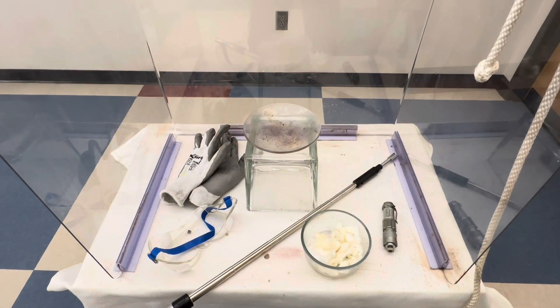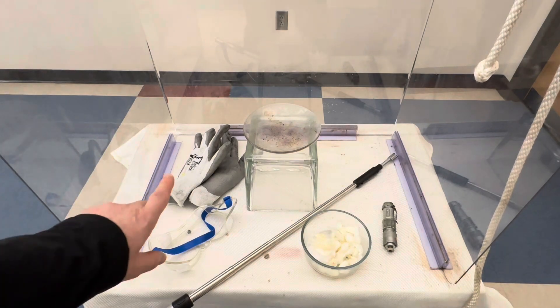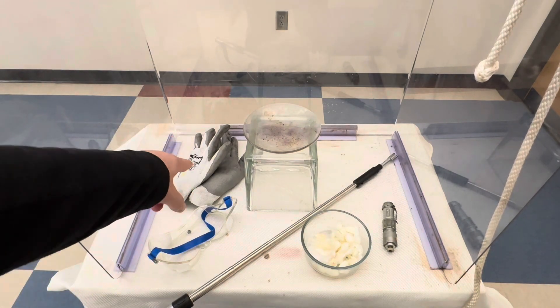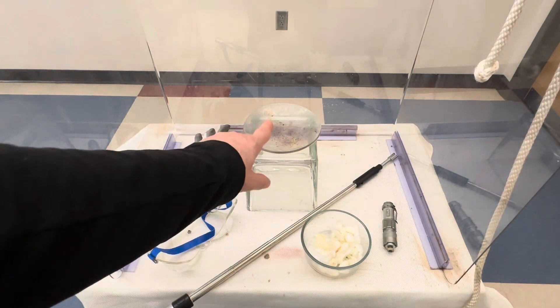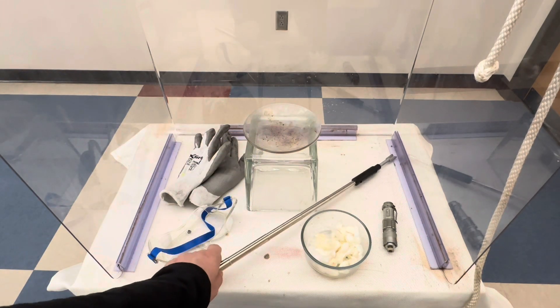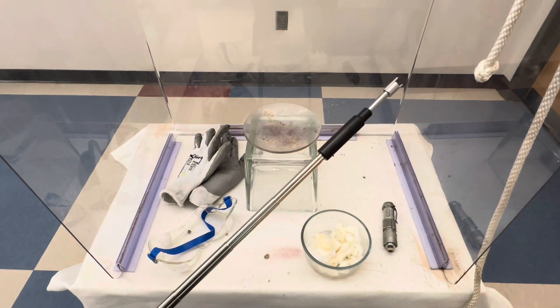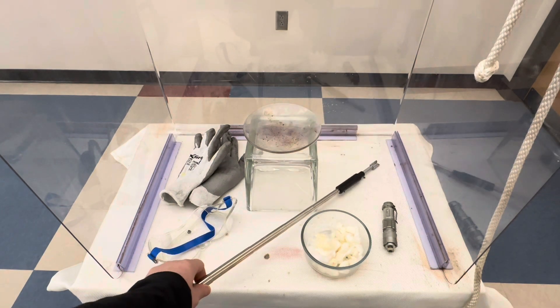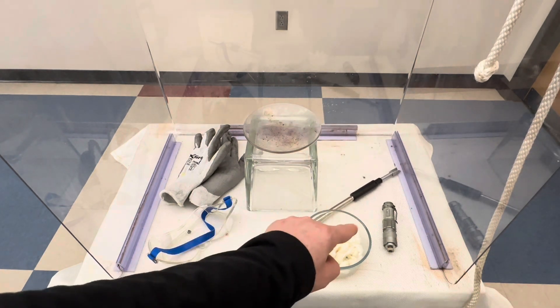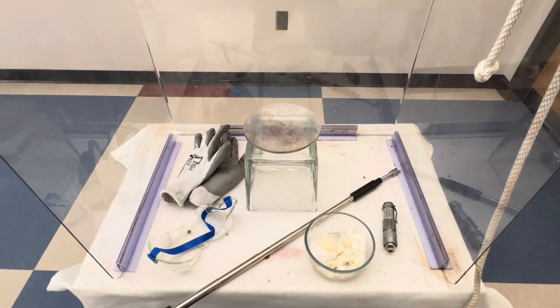During this investigation, students will use a blast shield, goggles, safety gloves, a petri dish. This is an extendable plasma igniter. Students will also use a blue laser and nitrocellulose.